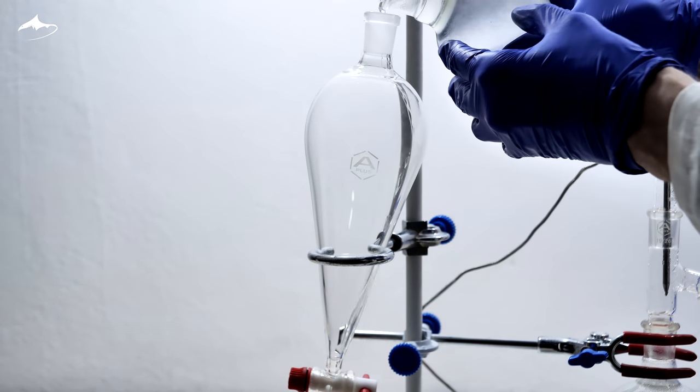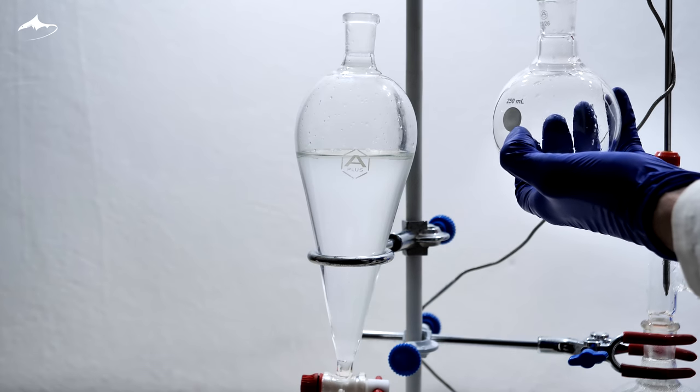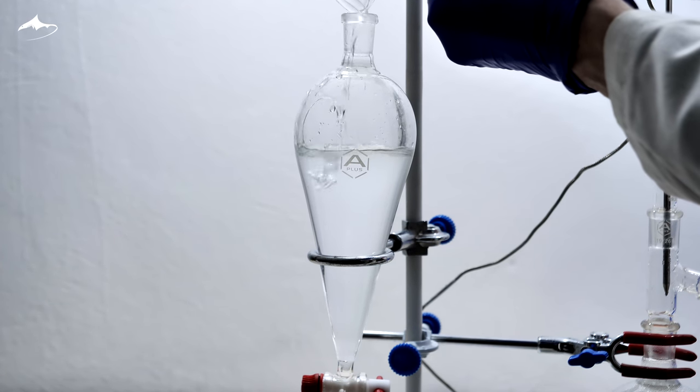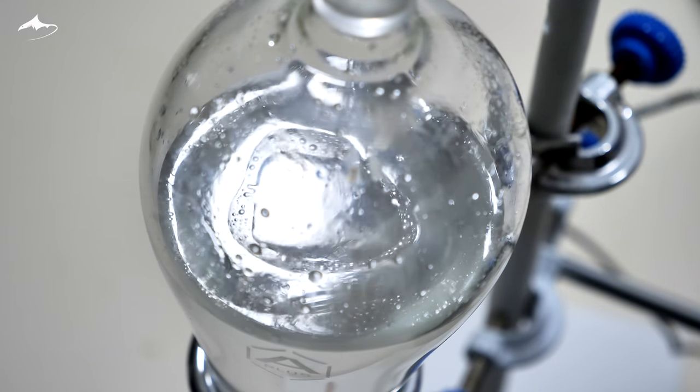First, I transferred the distillate into a 500ml separating funnel. The idea is to perform successive liquid-liquid extractions to isolate the butyric acid. Here is the organic phase floating on top of the water.